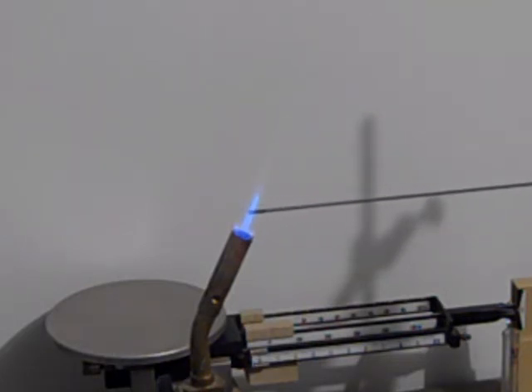It's sort of an orange, orange-red. Isn't that beautiful? It's not as deep a red as the lithium. Let's see if we get the calcium to work.